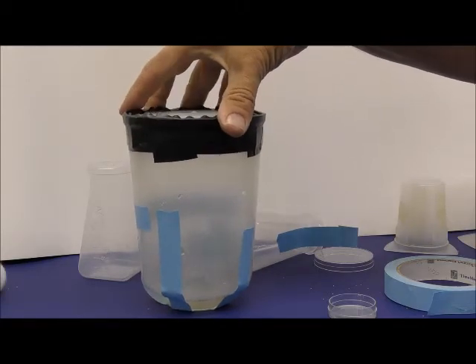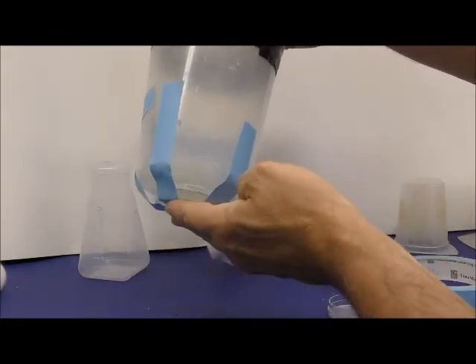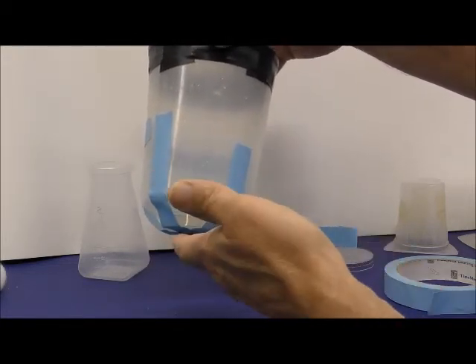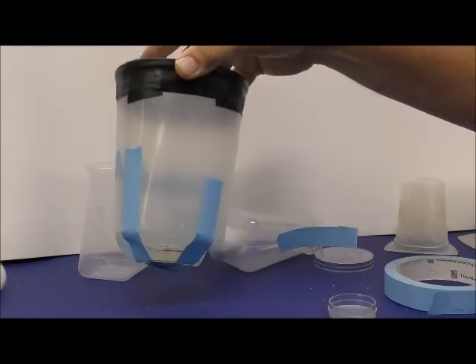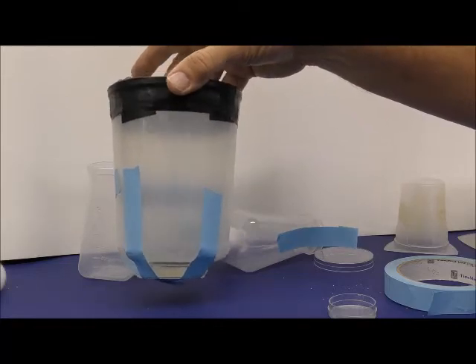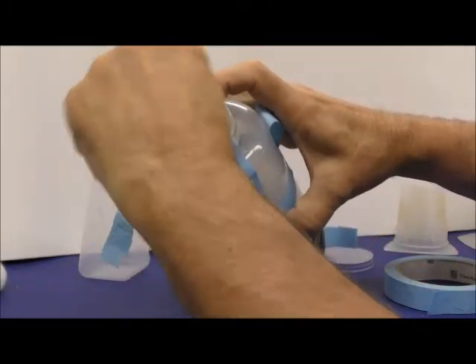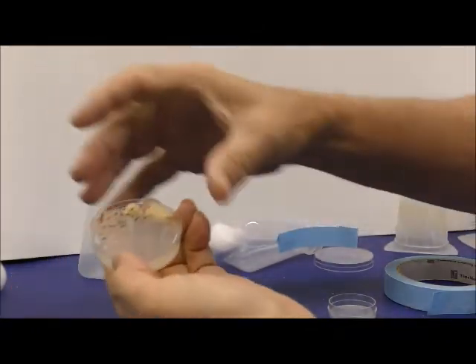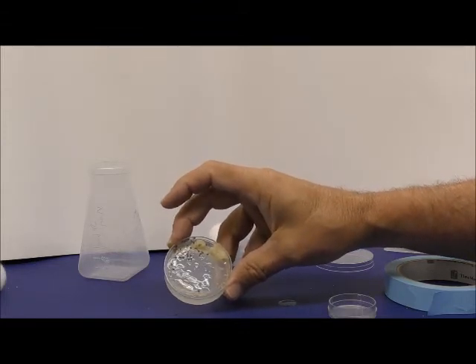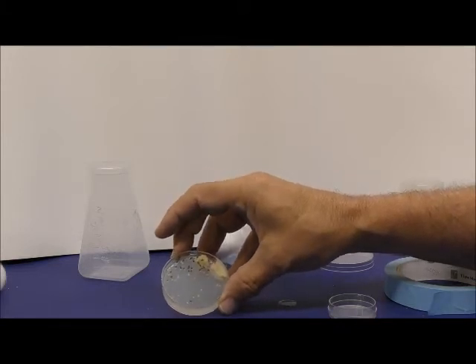So every day for 3 days, I change out this with the new one, toss the old ones, and then on the third day, change this out, collect eggs for 4 hours, and then put a new dish on. You can collect another batch for 4 hours. And now you have a very tight egg pulse for the larvae to develop. And then once you have that, depending on your collection, there might be some flies that stick to it as well. Then if you want first instars, wait 24 hours, and then you'll have first instars coming off the eggs.